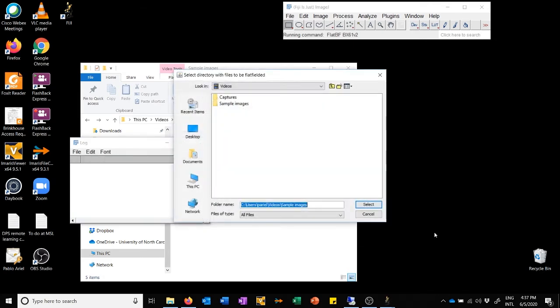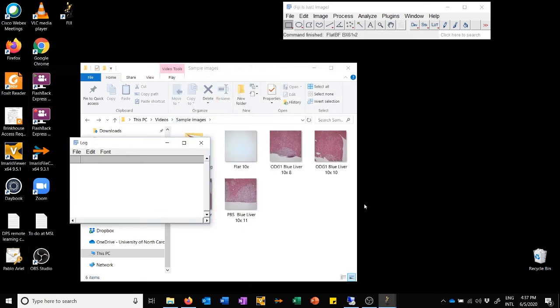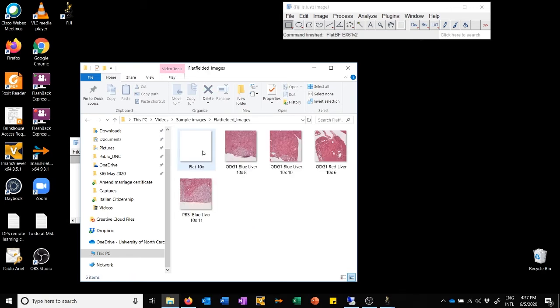Now it's going to ask me which is the folder that has the files to be flat fielded. And it's the same folder where we were before. So I'm going to say select. And what you can see is that it has generated another subfolder in here called flat fielded images. And this contains the results of this procedure.